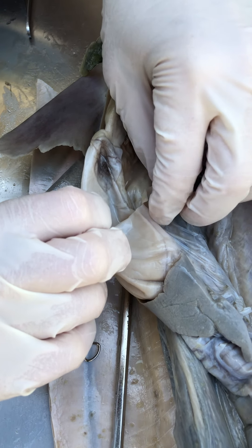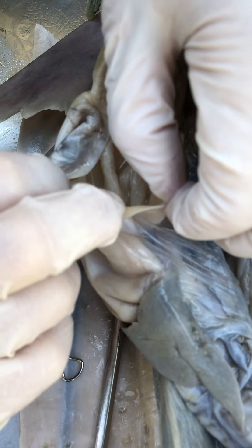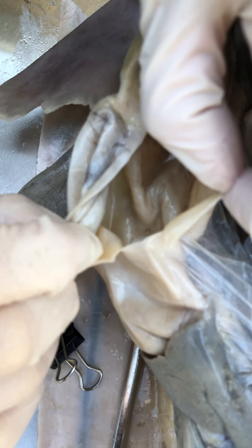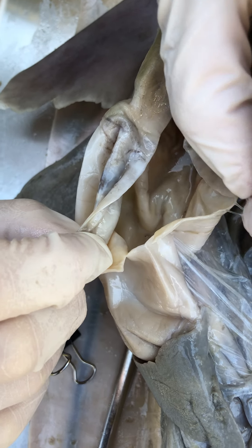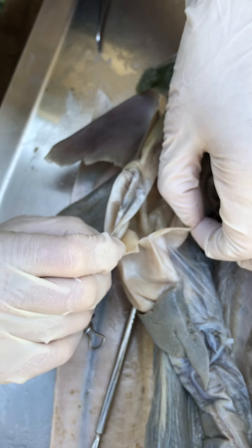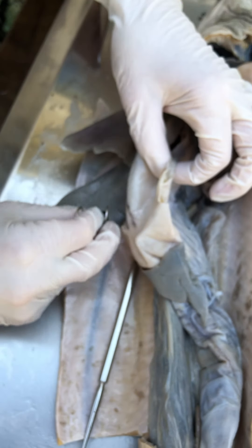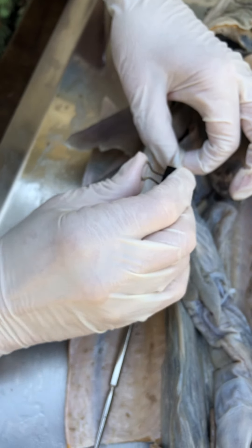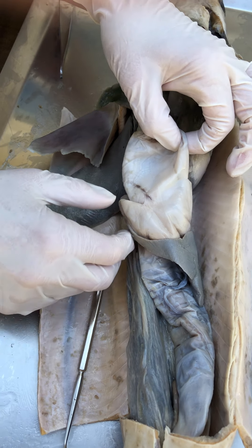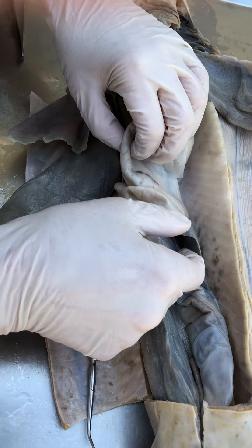This part of the stomach is called the pyloric stomach. The pyloric valve controls material leaving the stomach to go into the intestine. No rugae in the pyloric stomach — it's super juicy and pretty slimy in there.